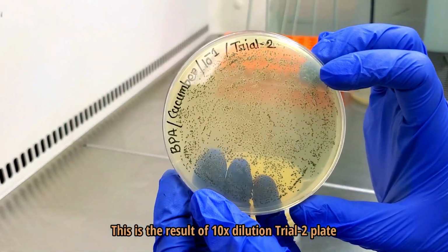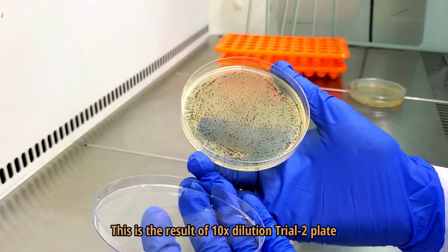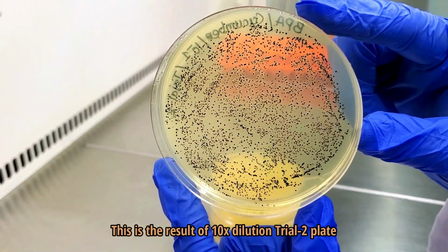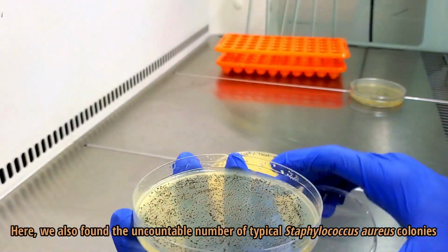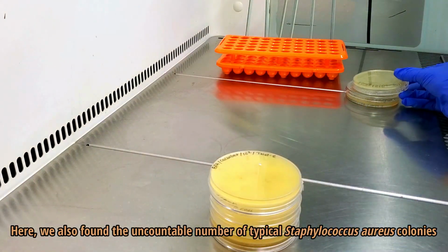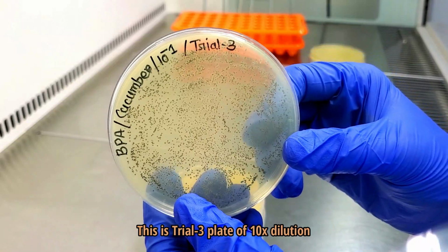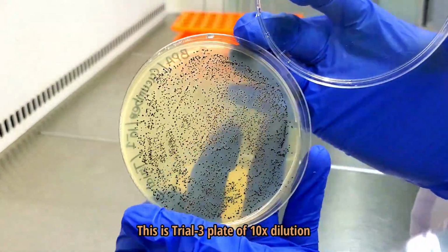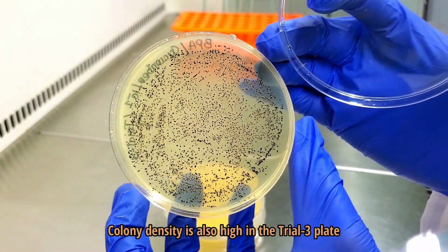This is the result of 10 times dilution trial 2 plate. Here we also found the uncountable number of typical Staphylococcus aureus colonies. This is trial 3 plate. Colony density is also high in the trial 3 plate.